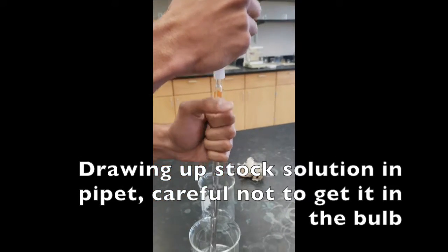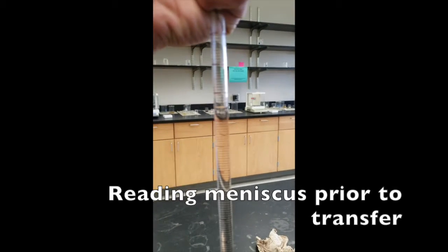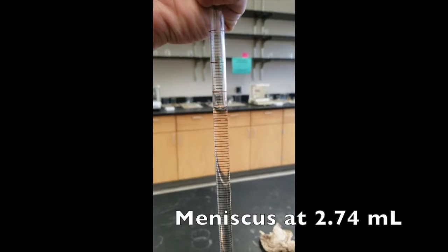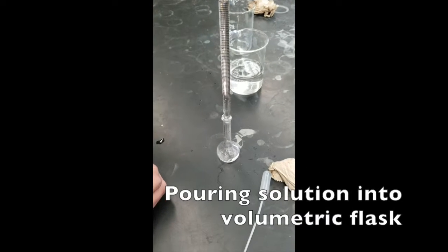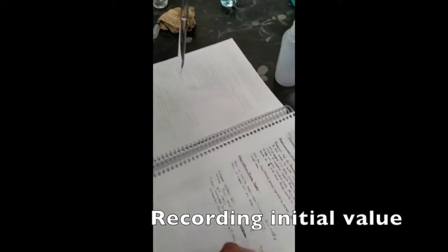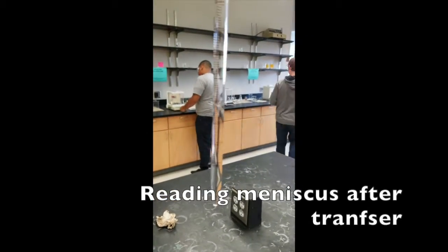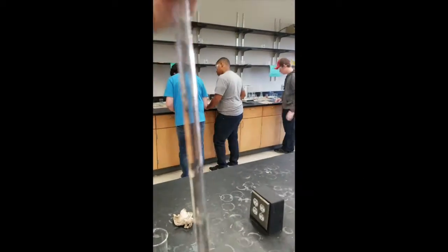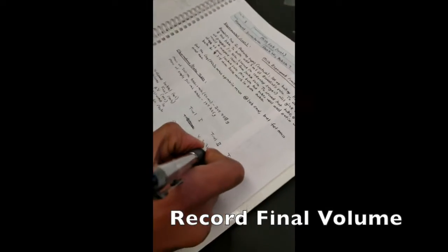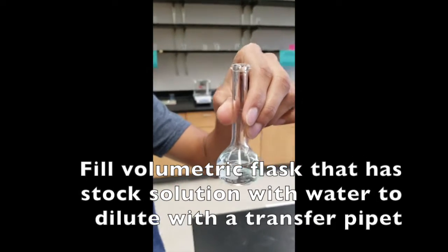So here I'm just filling it up to a certain volume. And let me read it at the eye level. And looking at the meniscus, it looks like 2.74. So 2.74 was our initial volume at eye level. And reading the bottom of the meniscus, 7.29. So these are the two stock solution in the 25 milliliter volumetric flask.